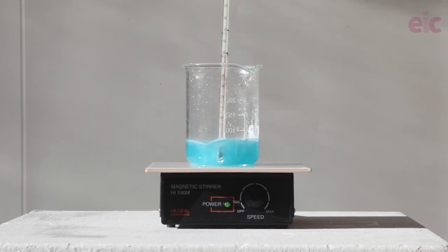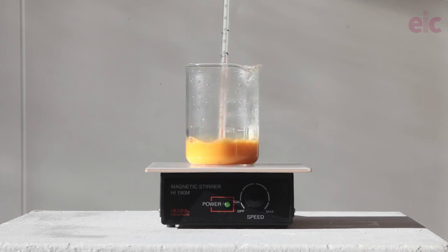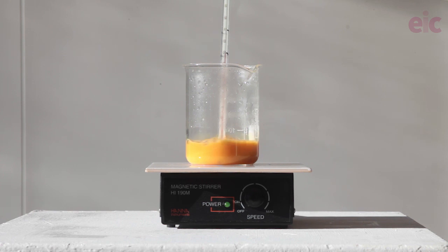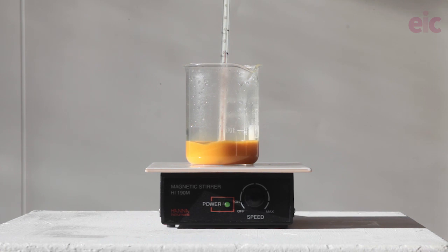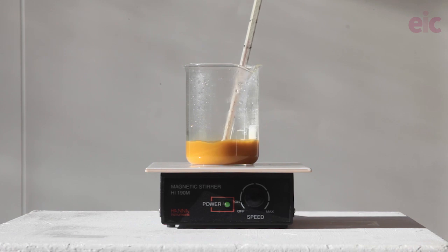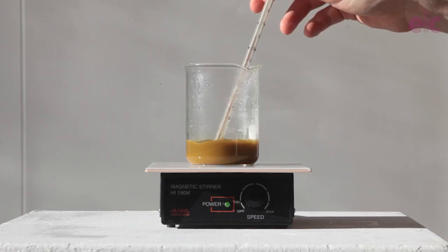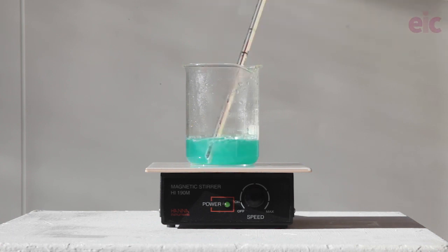We must have made a different, more darkly coloured complex. Bubbles of gas are being released, and then depending on the temperature you began with, after about 10 to 15 seconds the blue colour fades and a golden copper(I) complex is produced, while at the same time the temperature jumps up to around 70 degrees Celsius. Initially the copper acts as a catalyst for the decomposition of hydrogen peroxide. As the peroxide concentration drops relative to the tartrate concentration, the copper itself becomes a reactant and is reduced to the copper(I) complex.